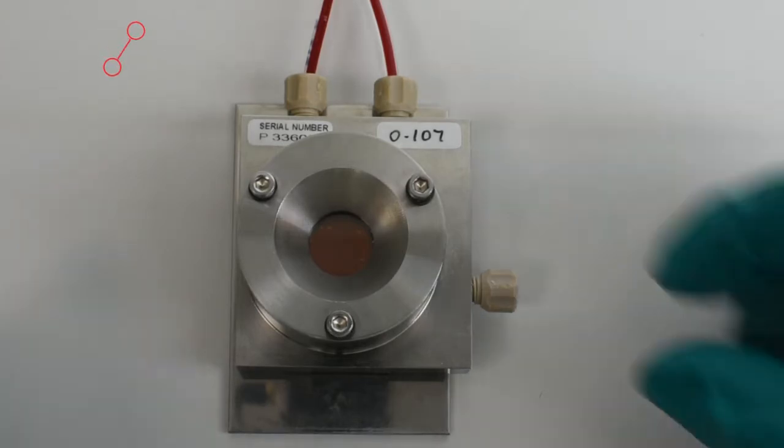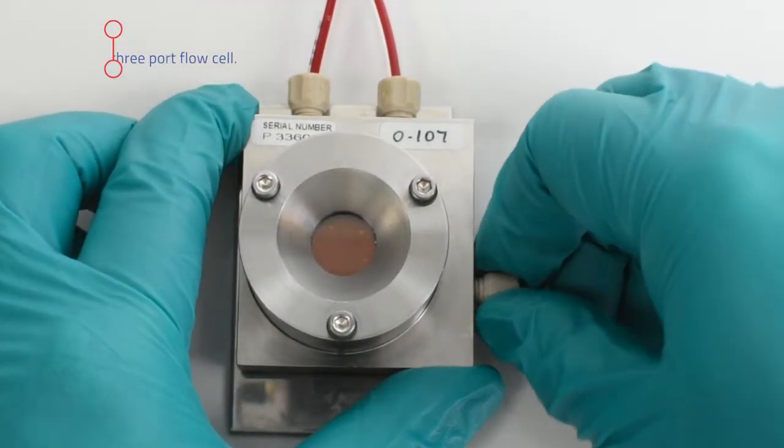To clean the cell, the third port is opened and then a cleaning solution injected through the cell.